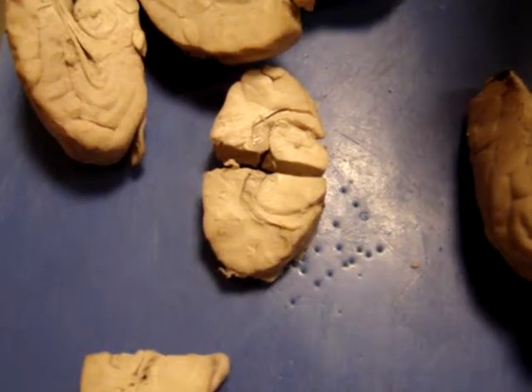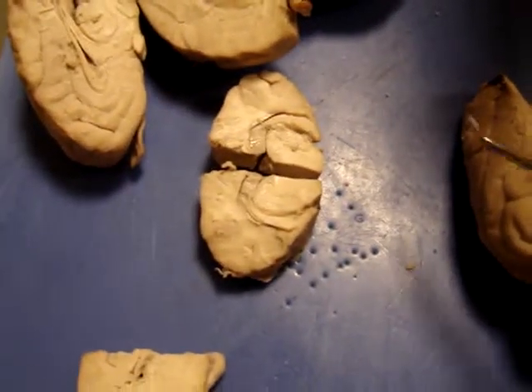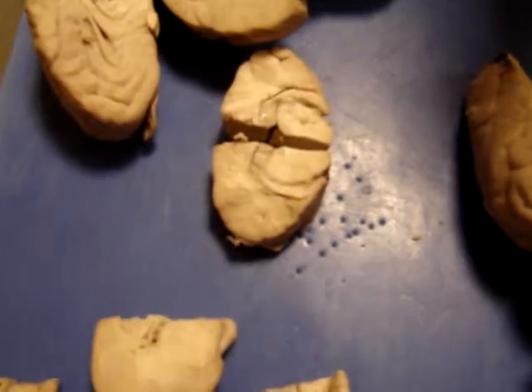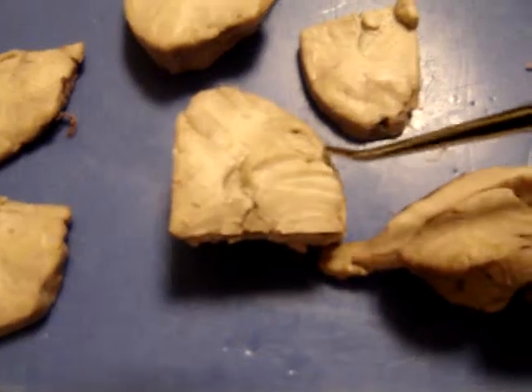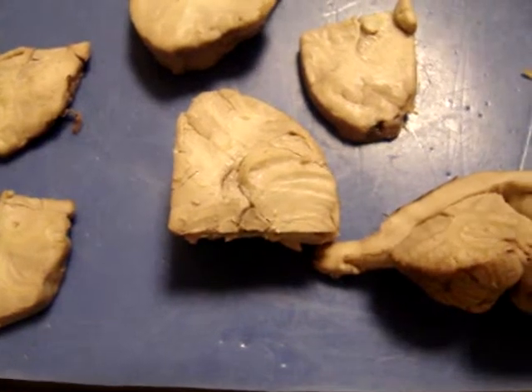It's towards the frontal part of the brain, right? Not really. It's more like right in the middle of the brain. It's back in the back part of the thalamus, and right through the pineal gland is what we ended up going through. So more like midbrain area. And here's another view of it. Here's pineal gland. And then here's a little edge of hippocampus. Can you see it as it arches around, a little piece of it right there?